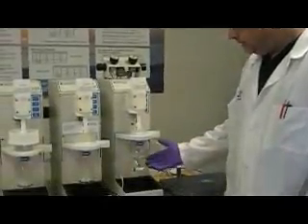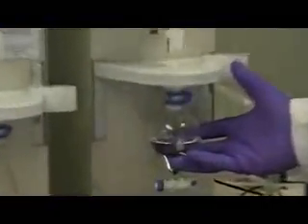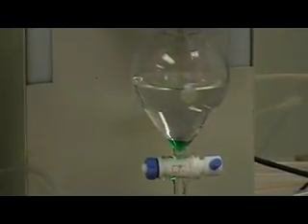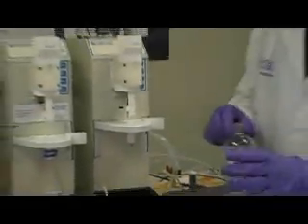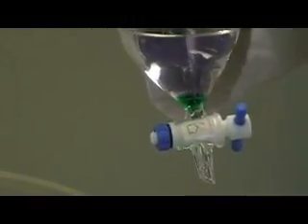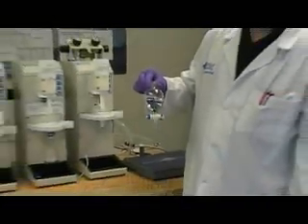So what I'm showing here today is a SEP funnel after 4 rinses simulated on a 90 millimeter oil and grease disc. You see about 60 mils of hexane and a small amount of residual water, which I've indicated by green food coloring to make it easier to see in this video. So you take it off of the extractor and you see it looking about like this. Now normally the water is heavier than the hexane, so you will see a water layer. It's very easy to see with the green food coloring, but normally if it was clear you would see it below the hexane layer.